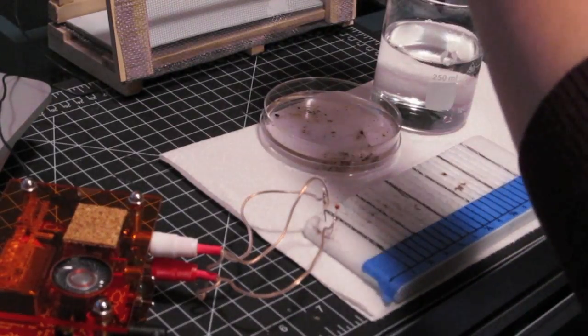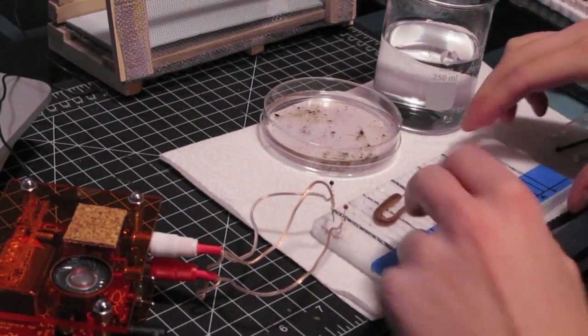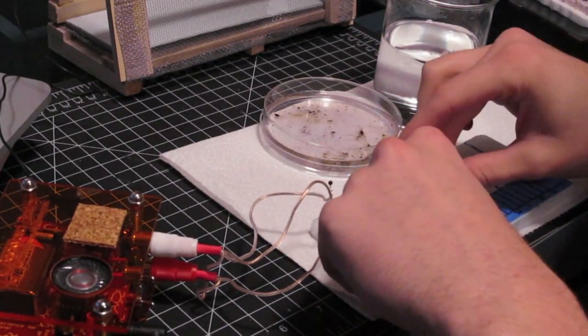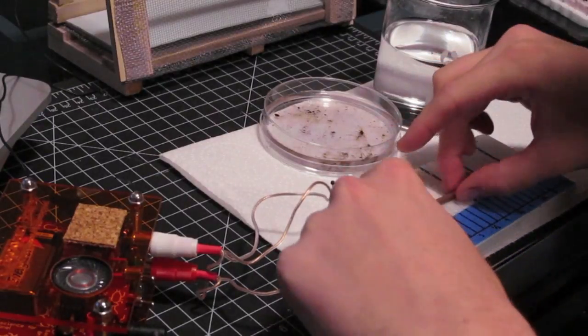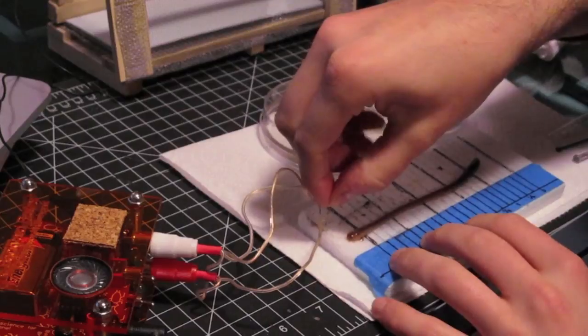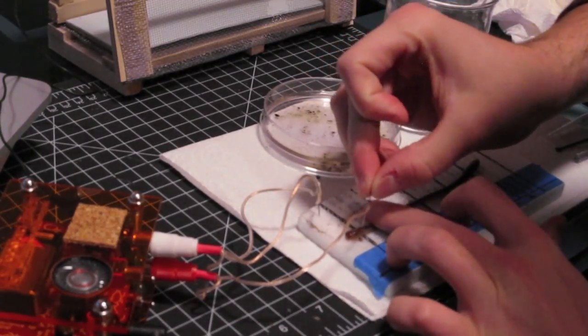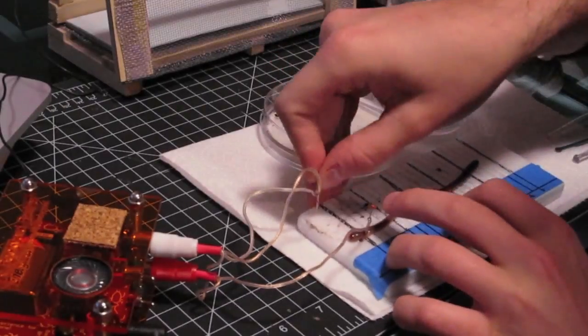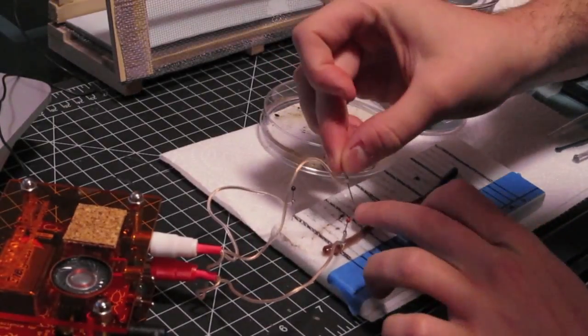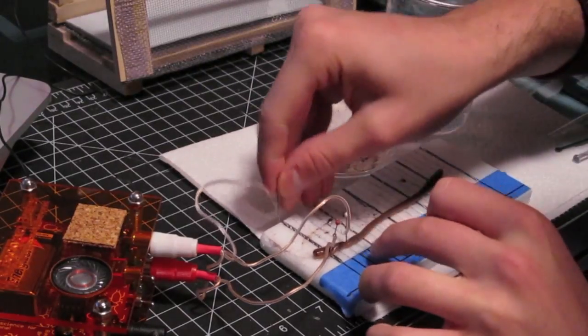This experiment is in many ways just like the first earthworm experiment. Place the worm dorsal side up so the dark side of the worm faces up towards you. Also, make sure that the posterior or back end of the worm is closer to the left edge. Start by inserting the electrodes into the worm, slightly off the center line. Place electrode 1 closer to the posterior end of the worm and electrode 2 half an inch further up the worm. Place the final ground electrode near the anterior or front end of the worm.